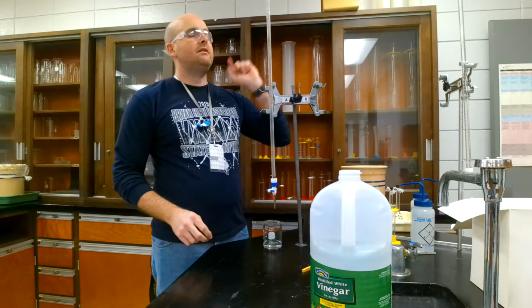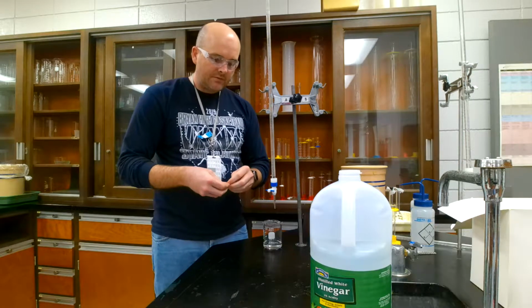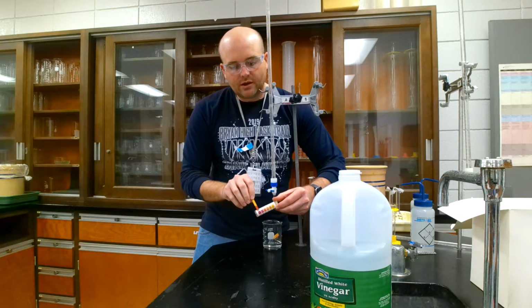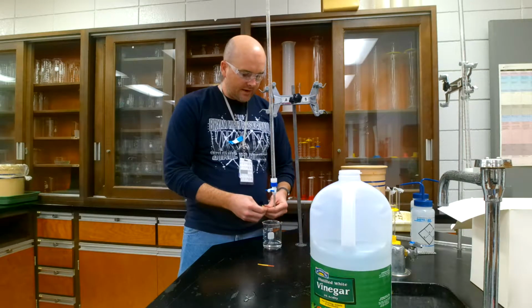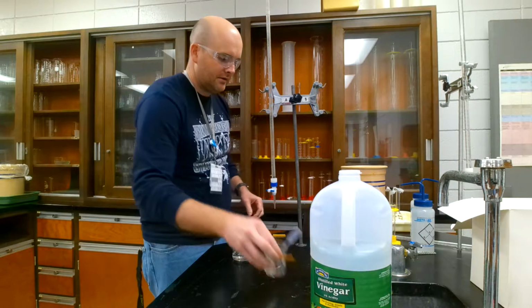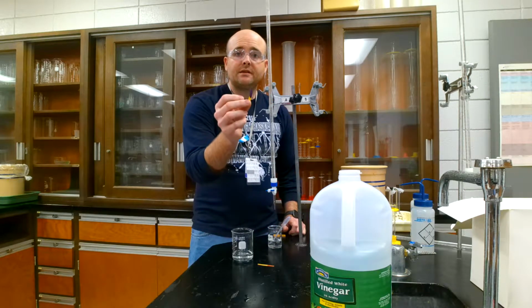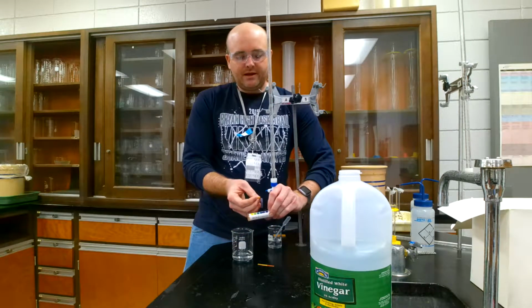And what I have in here is sodium hydroxide. So vinegar is an acid. I can prove that to you by taking a litmus paper strip and sticking it right there, and you can see it turns it red. So that has a low pH, which means an acid has a low pH. And then this guy, what is in here, let me go ahead and try to get, there you go. You can see it turns the litmus paper blue. Okay? So blue litmus paper means a very high pH.